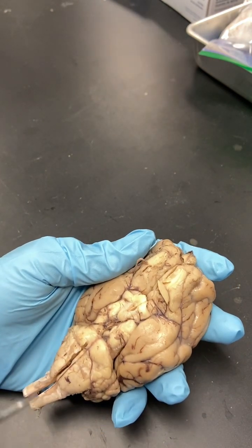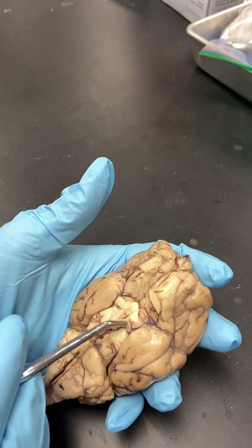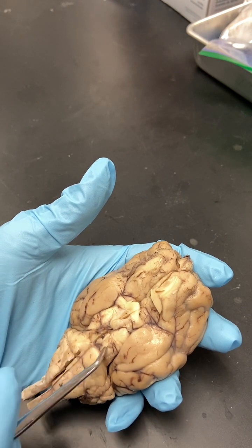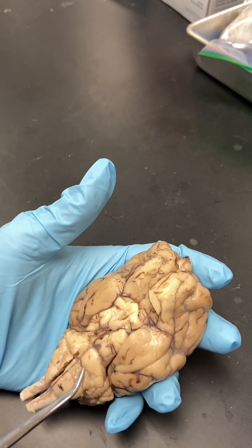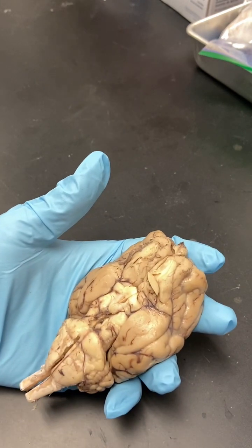And then, of course, this is your brain stem. And let's see, some little oculomotor nerves all along here. This is the mammillary body, which you don't need to know. I think those are all the structures that you need to know.